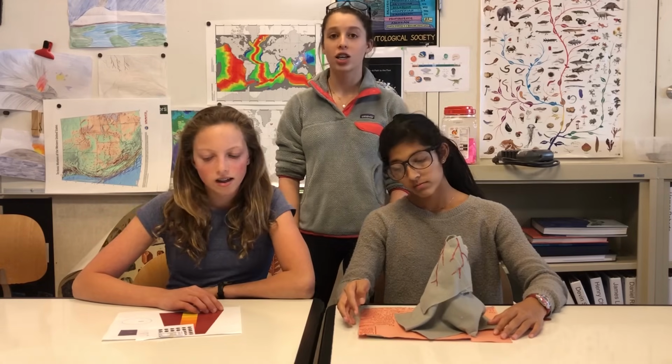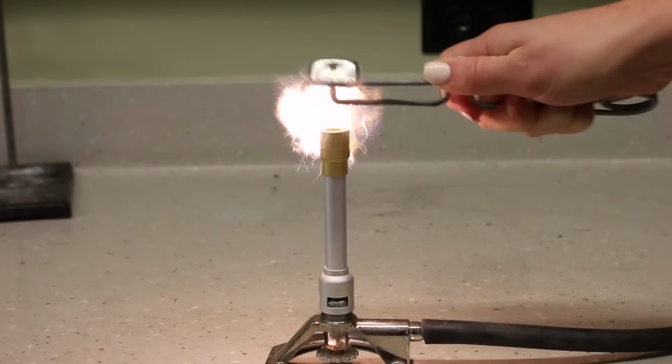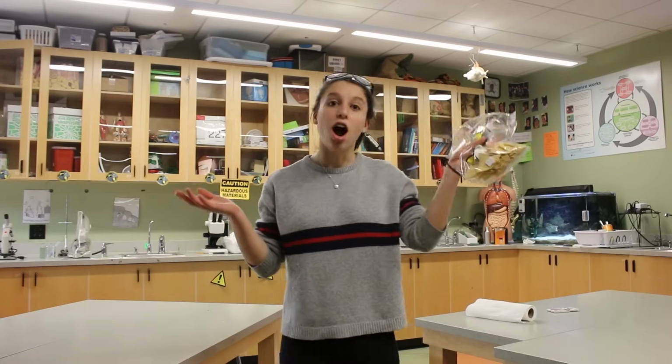Wear your hair up in a tie so it doesn't ignite. Don't even take a bite of the food. Yes, there are rules.